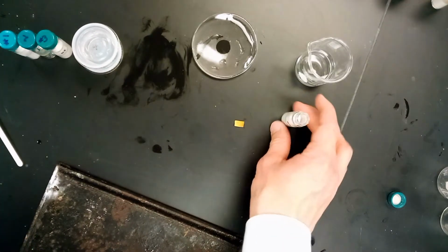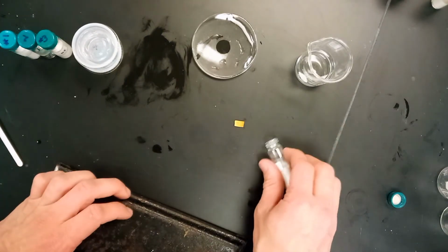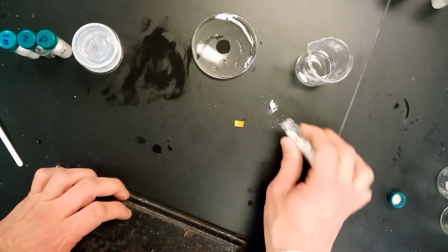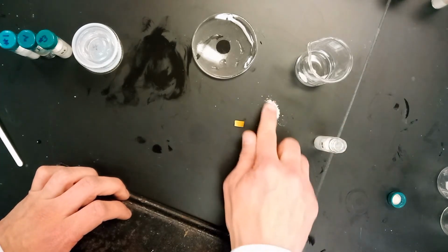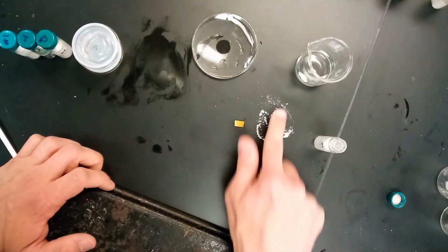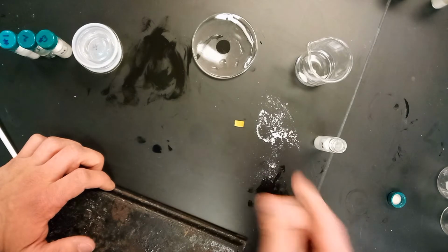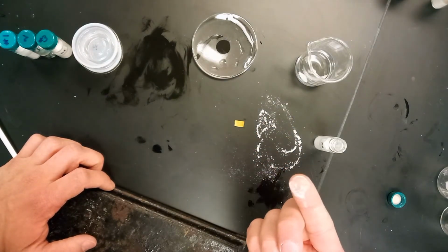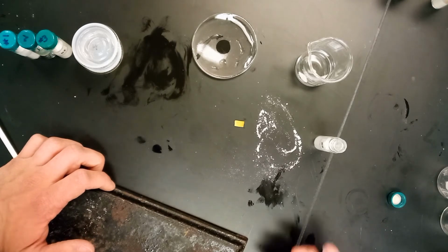I suppose another thing to consider about number 5 is how it looks. So again, we'll put a little bit more on the table here. Oops, that's a big chunk, but it reminds me a little bit of sugar. It's got a coarse feeling to it. You can't write with it. So it's a sugary substance, I suppose we could call it.